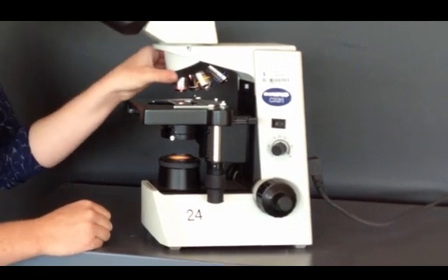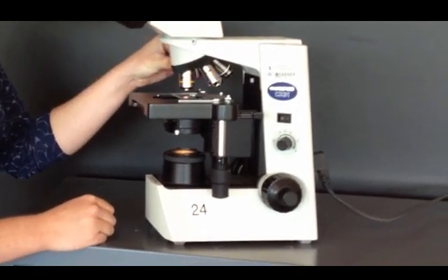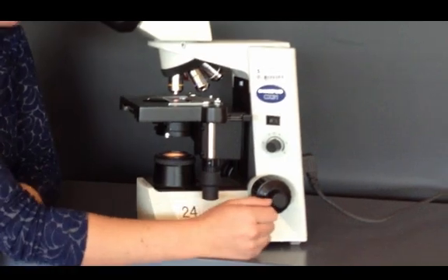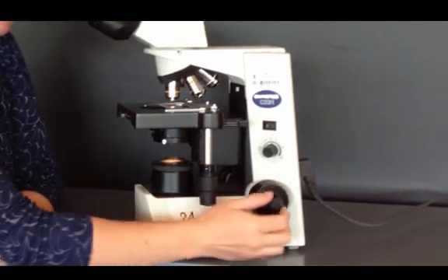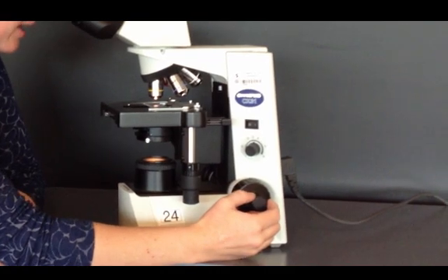Then, you can rotate to the next highest objective. Now, look through and use only the fine adjust to bring the specimen into focus.